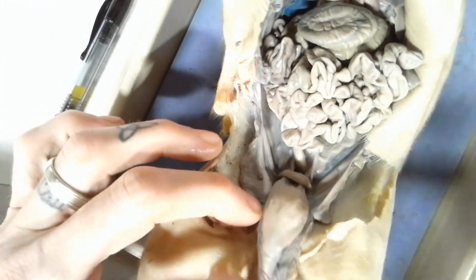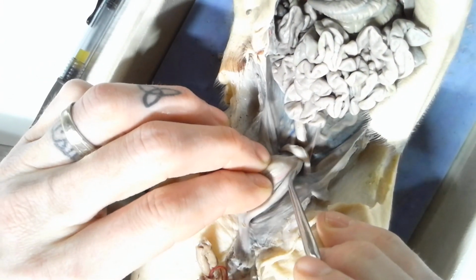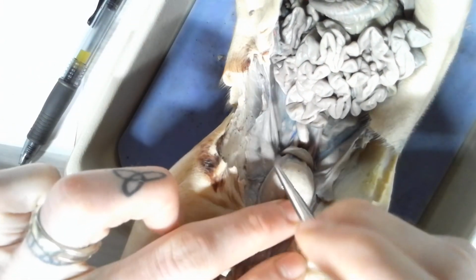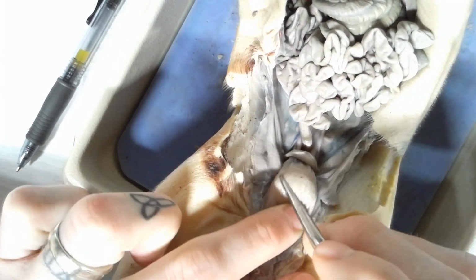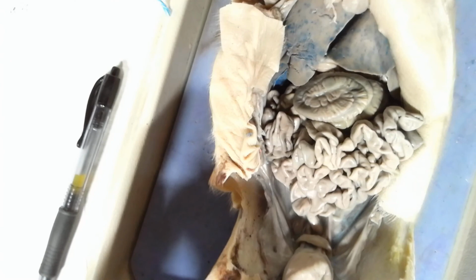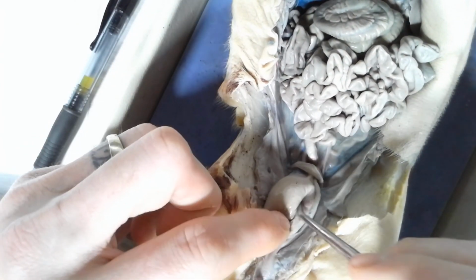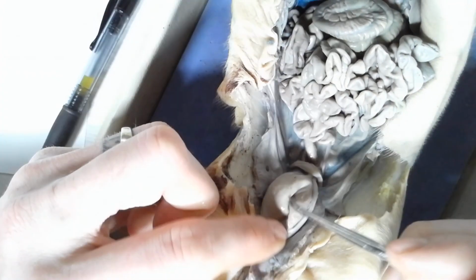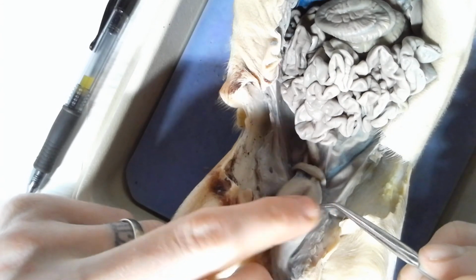The umbilical arteries are down a little bit lower. So you see this structure right here. So you see this right here, one side, and this on the other side. These are the umbilical arteries. So there's two umbilical arteries, one umbilical vein. So again, the umbilical vein is connected to the liver. The umbilical arteries are on either side of what this is, the urinary bladder, or just a bladder. Okay, so the bladder is right in the middle of these umbilical arteries.